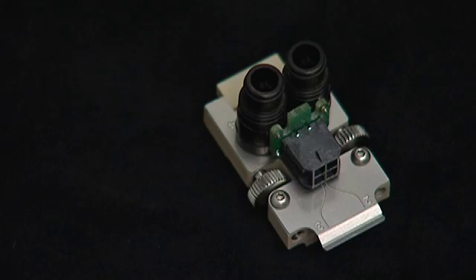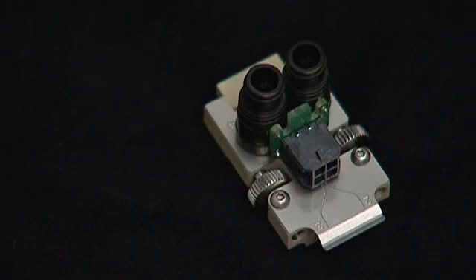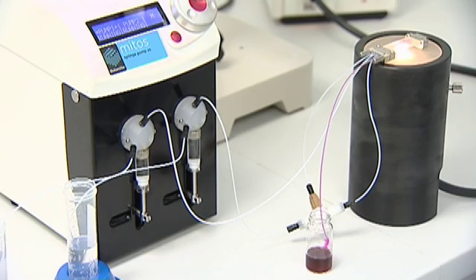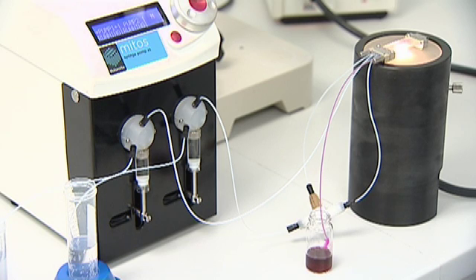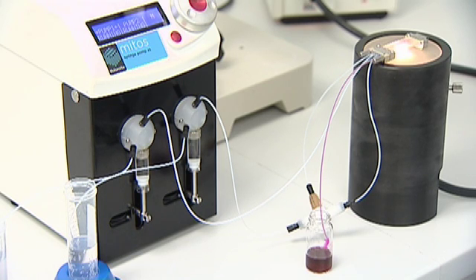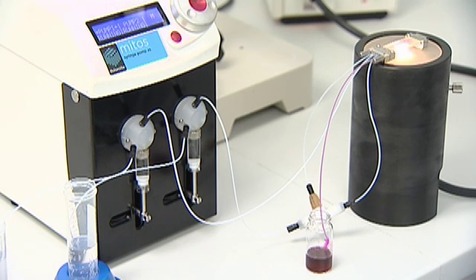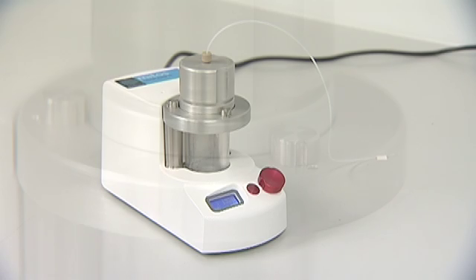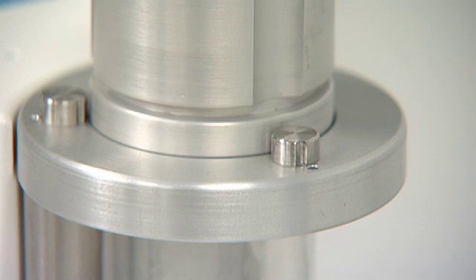Dolomite offers a range of pumps to allow you to select the optimum technology. Here, a dual channel syringe pump is used to give accurate flow rate and automated control.